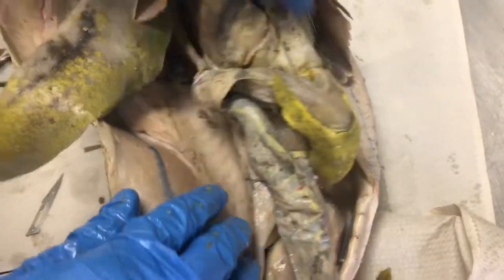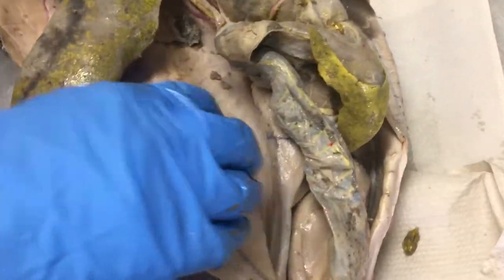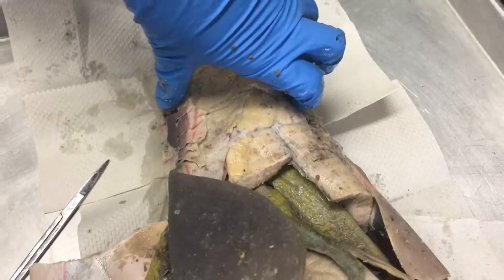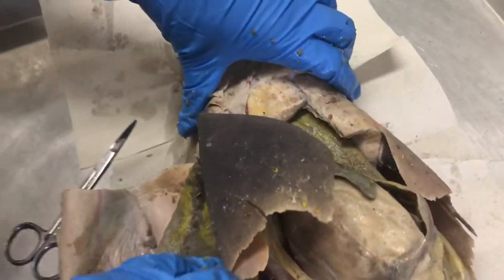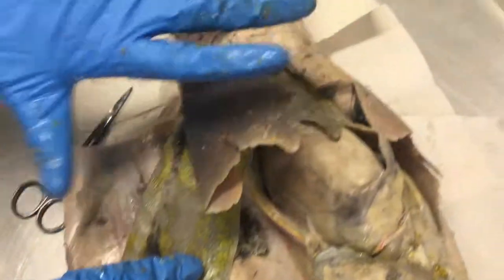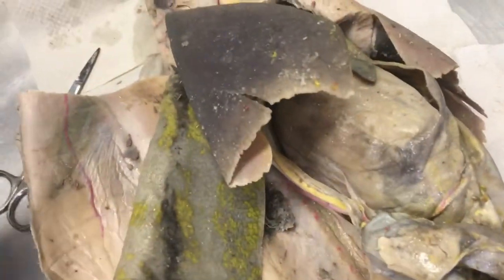The pericardial cavity is up here in this section, and then the pleuro-peritoneal cavity would probably be in this area — that's what I'm assuming.